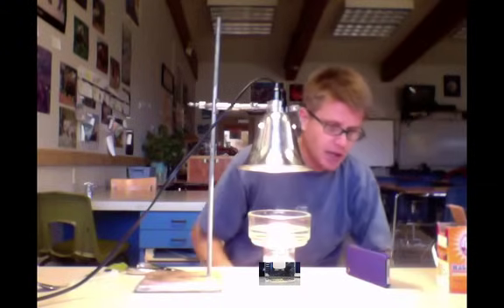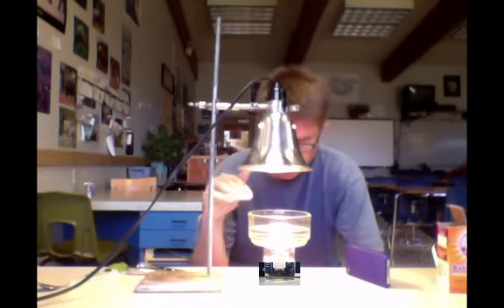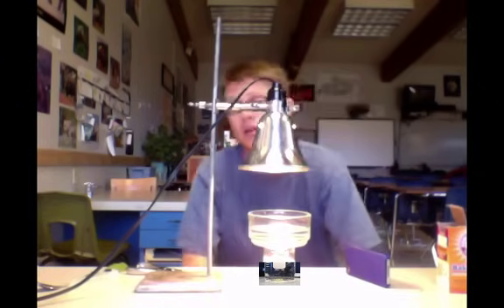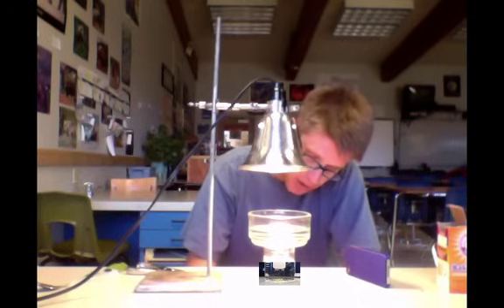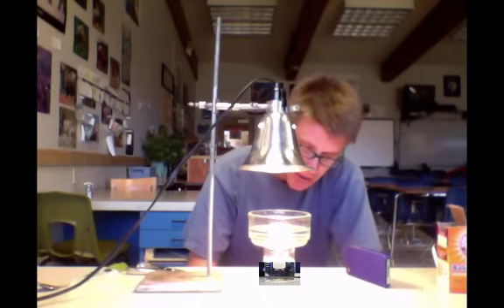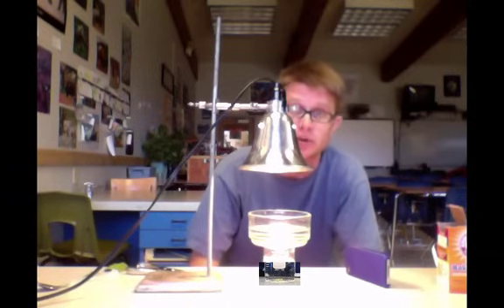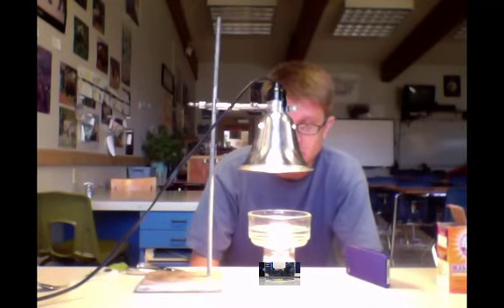What's going to happen next is that the light is going to start to provide energy into the thylakoid membrane of the light reaction. It's then going to start to split the water and that's going to create little bubbles of oxygen. Those bubbles of oxygen are going to make the leaf chads more buoyant, and eventually they're going to float to the top. What we're doing is we're measuring the rate of photosynthesis.